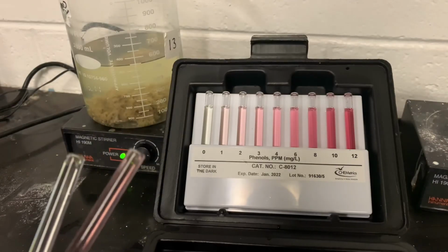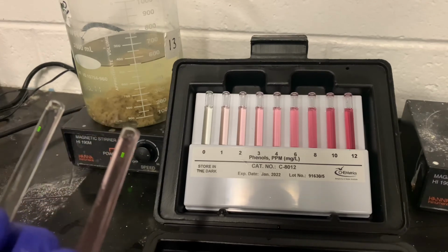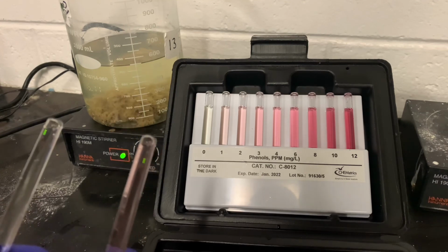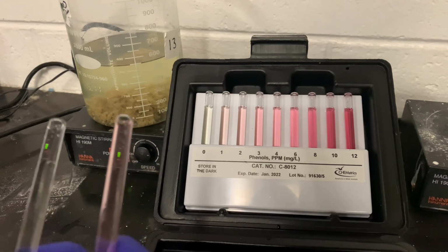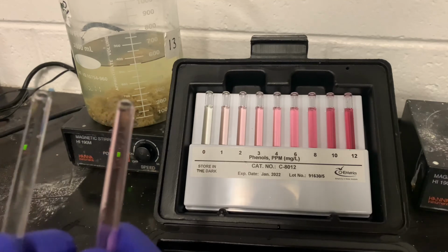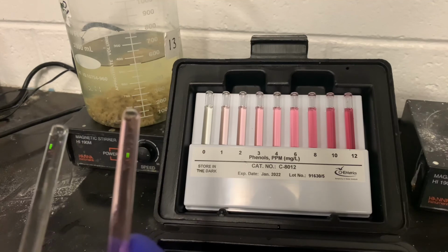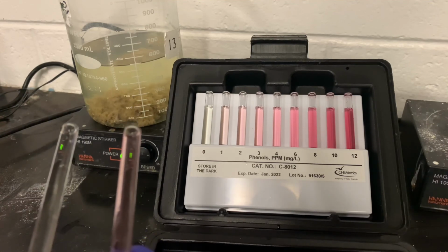So I got the results back on our higher dose of permanganate and our lower dose. And as you can see, the higher dose has none in it, and the lower dose still has about 1 ppm in it. So if we were testing this for a real customer, we would just keep bracketing it lower and lower and a little bit higher until we found the perfect dosage for our customer to use in real time.